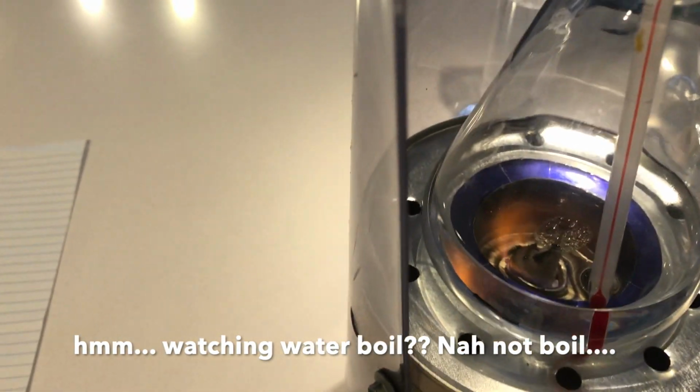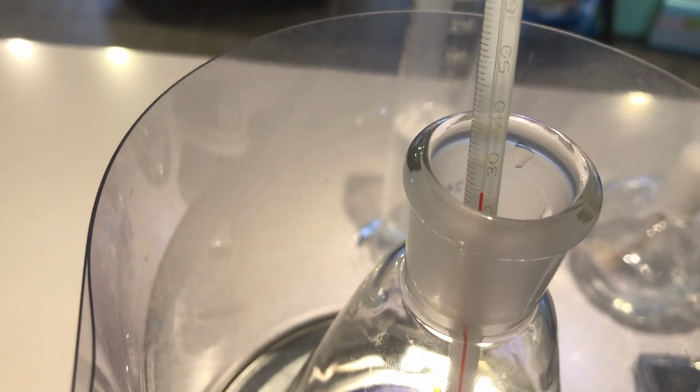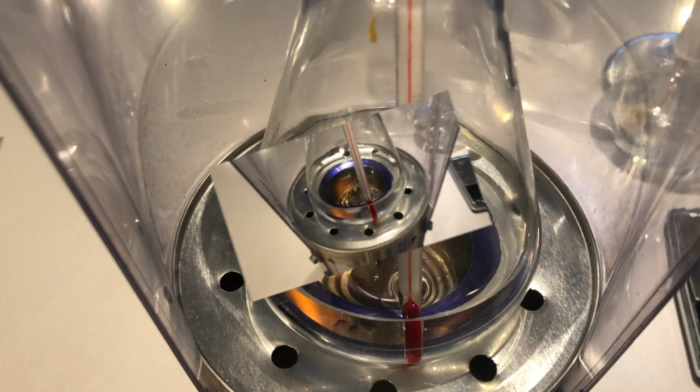It's already gone up by quite a few degrees. About 4 or 5 already. Approaching 25, it started at 19. And that's only after a minute.